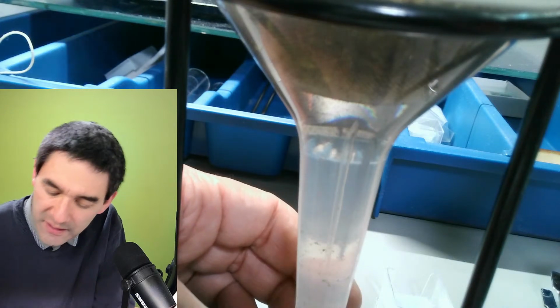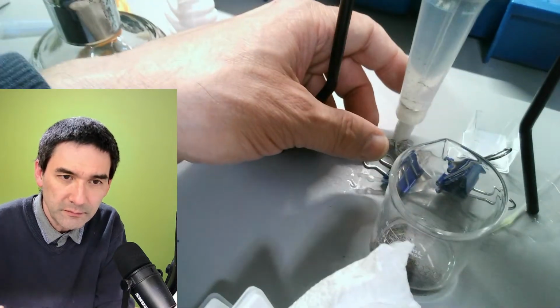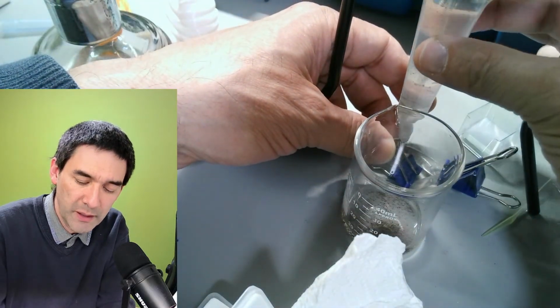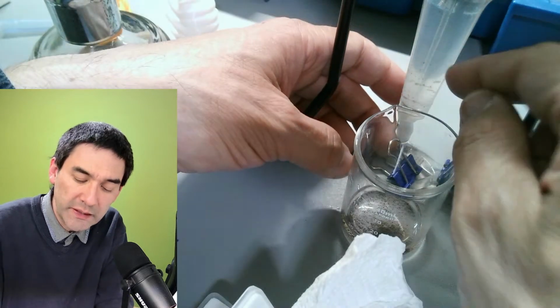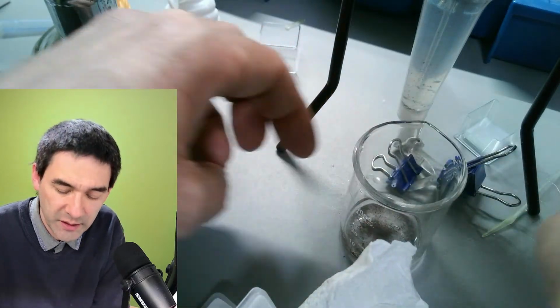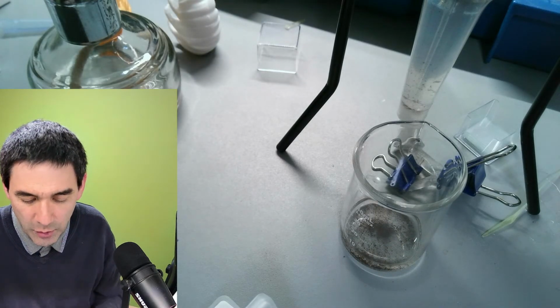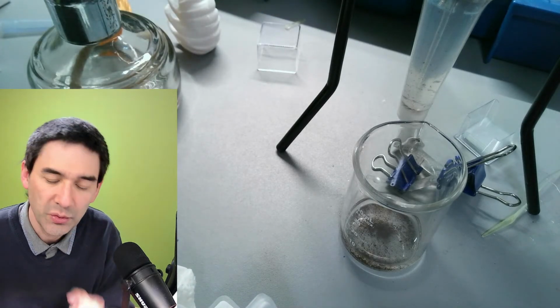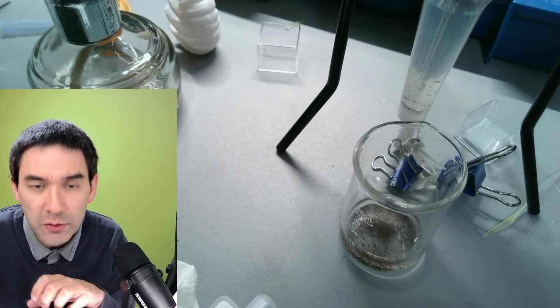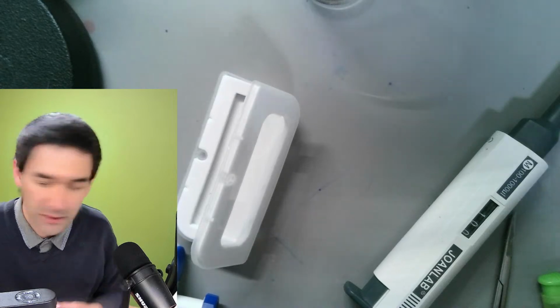So this is a little bit the next thing that I'm trying to experiment with, so that I'm able to put a beaker like this beneath the funnel, and then somehow either by pushing something or by, I don't know, releasing a clamp, I'm able to directly collect the sample in a beaker. This system right now is just not satisfactory, obviously. So that is something that I'm trying to work on as a next option, because when the whole thing is optimized, then of course you can use this to collect microorganisms also from soil, from other matter as well.